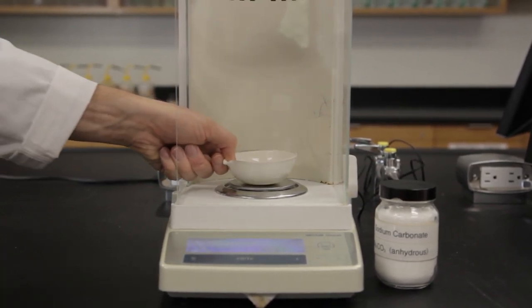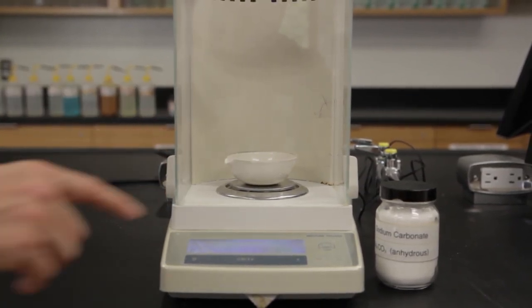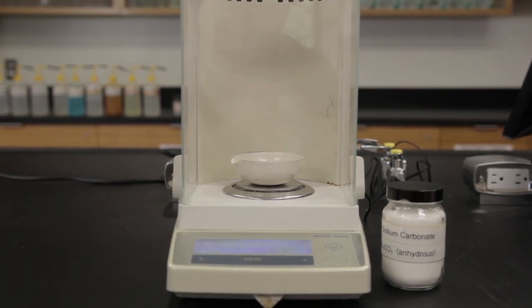Weigh the evaporating dish only after it's at room temperature and record the mass. Be sure to record every single digit on the balance.